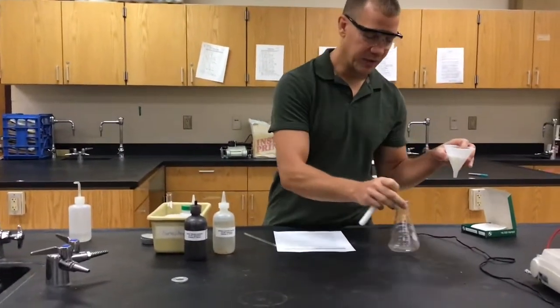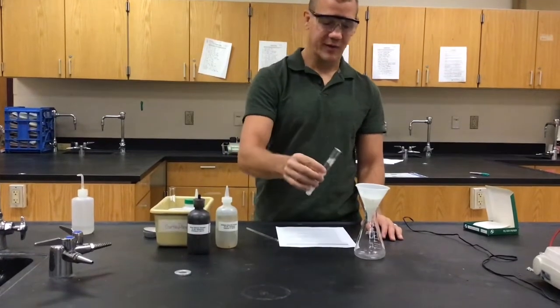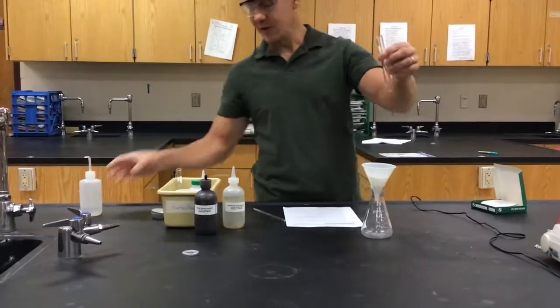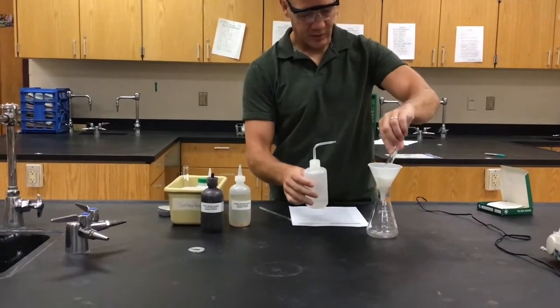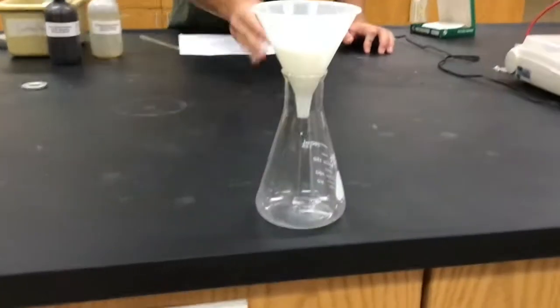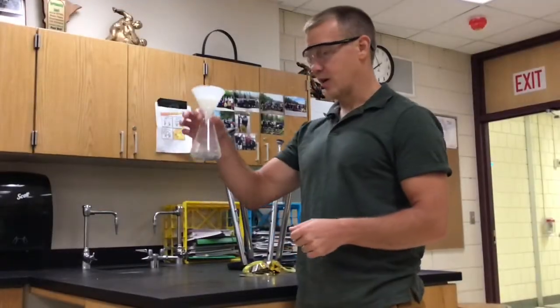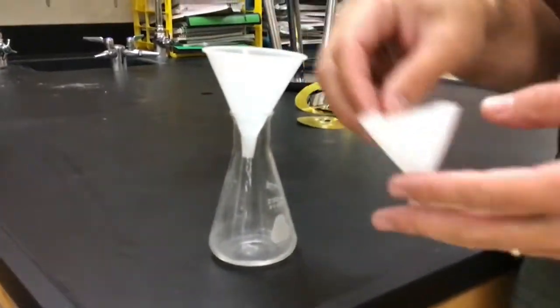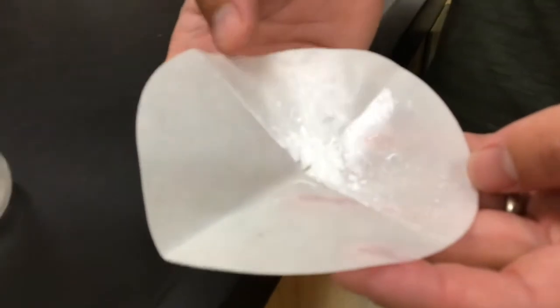I like to use a simple filtering apparatus where I just put my funnel in an Erlenmeyer flask — the triangular-shaped flask — and now we're going to filter this liquid. Pour it in there; there's a little bit of leftover residue, so we can use distilled water — purified water — squirt it in there and get it out. You can see that the liquid dripping down is clear. If I pull out the filter paper, what we see is a nice white solid in there, so it filtered out the white solid leaving behind the clear liquid.